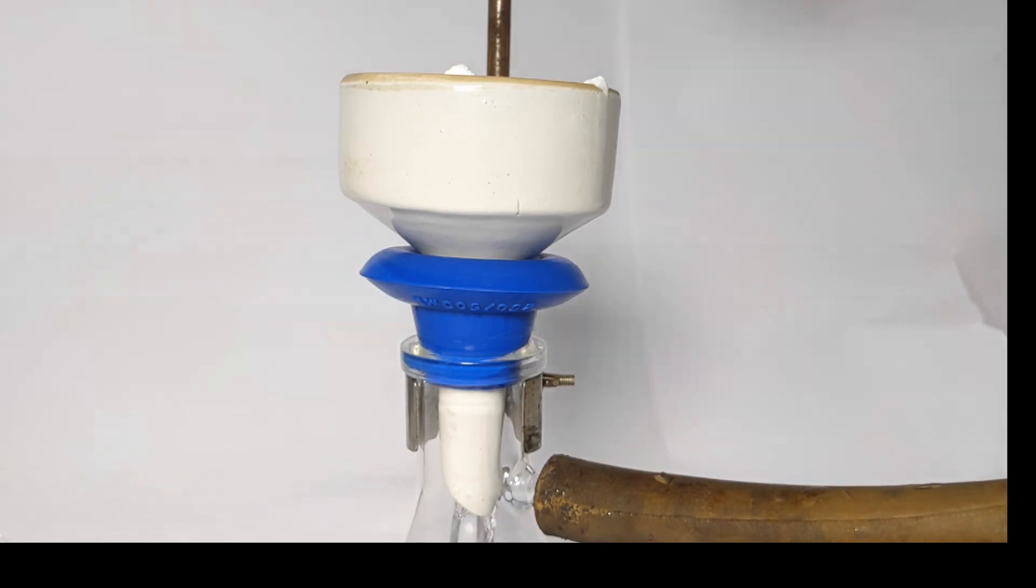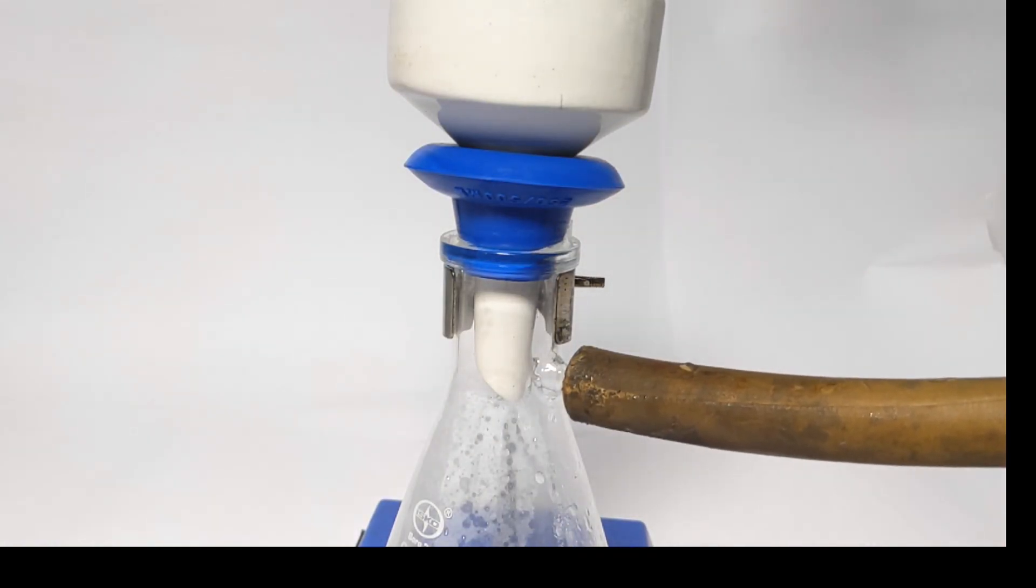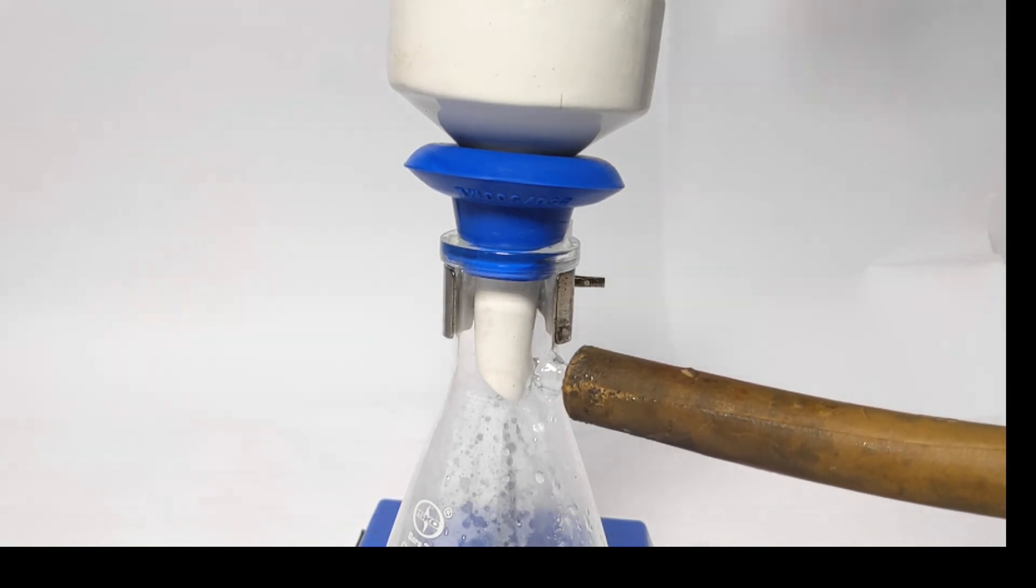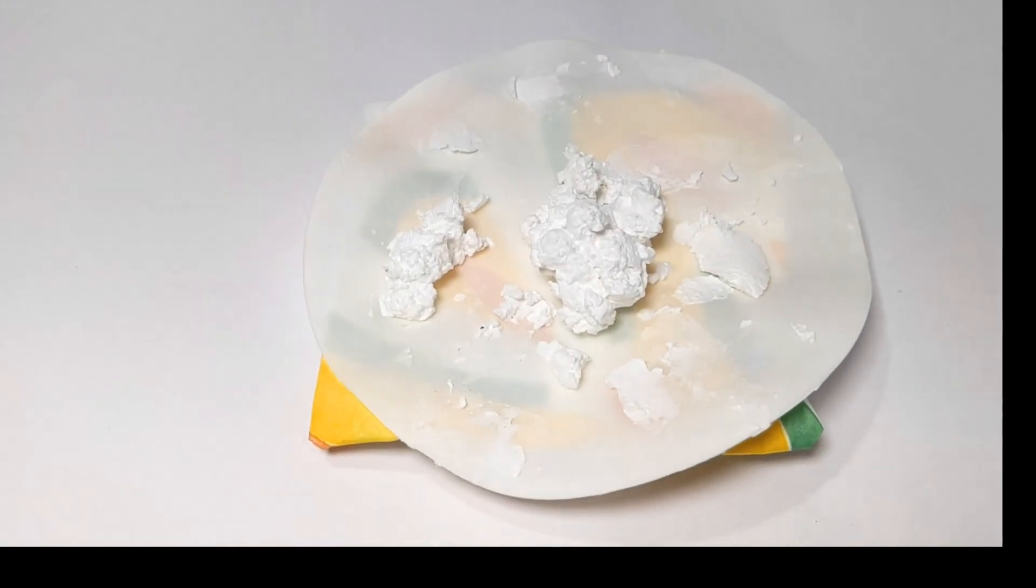After 30 minutes of stirring and cooling in an ice bath, the precipitate was vacuum filtered. This is the crude product that was obtained.